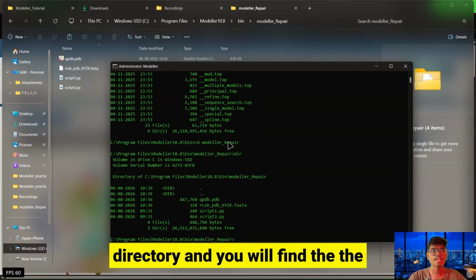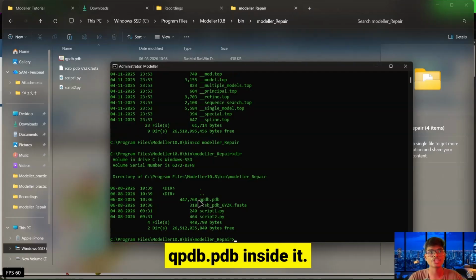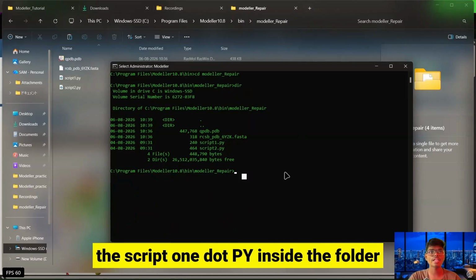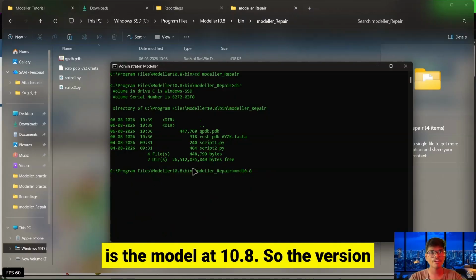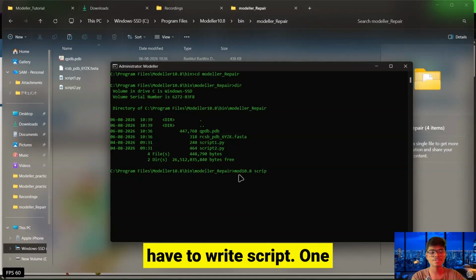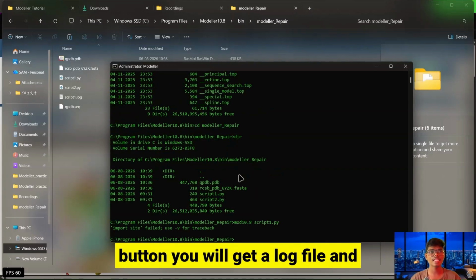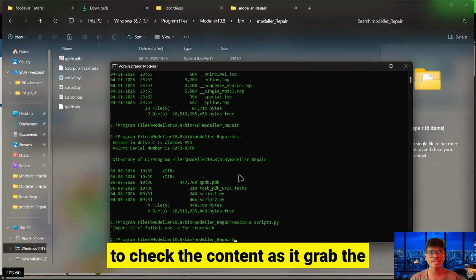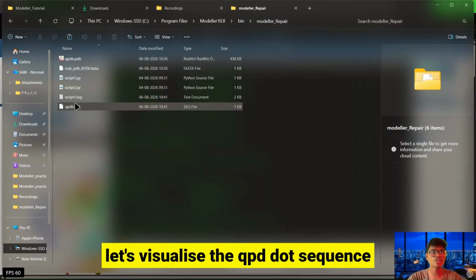Let's check the directory, and you will find the script files contained there, and we also have the qpdb.pdb file inside it. So we are ready, and we have script1.py inside the folder. Let's hit the command mod10.8. This is the version of modeller, so the version should be written here, and then write script1.py and hit enter. After hitting enter you will get a log file, and you will find a .seq file. This .seq file is important to check the content, as it grabs the details from the qpdb.pdb data file.